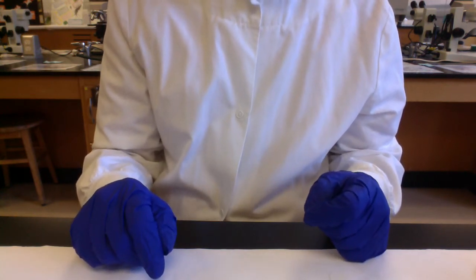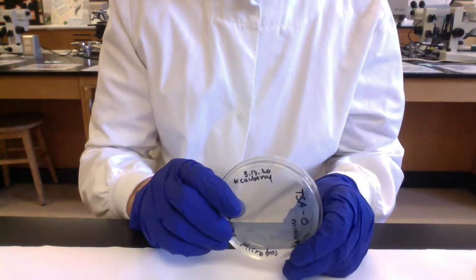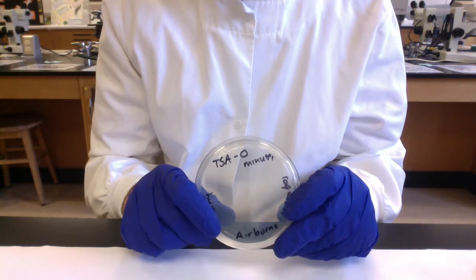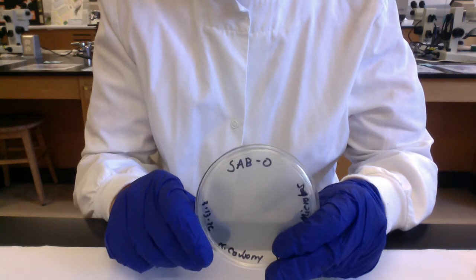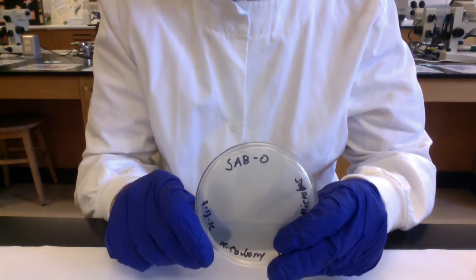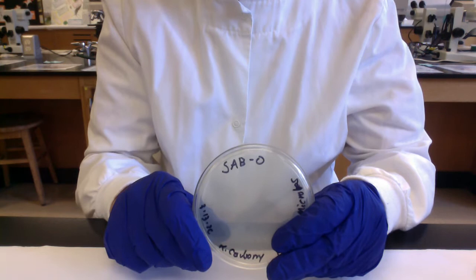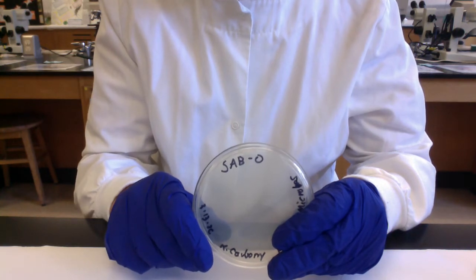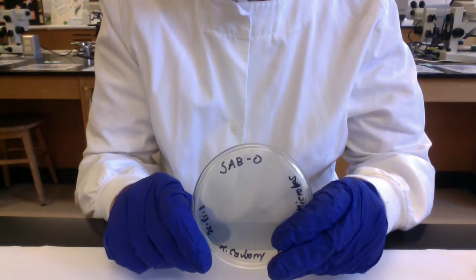So the experiment is set up to compare two different types of media. Tryptic soy agar, which you might remember, is an all-purpose medium, it should support the growth of a wide range of environmental bacteria and fungi. And then the other medium we're going to test is the Sabouraud's dextrose medium. And you'll recall we said this is selective for fungi. It has a high dextrose glucose content, which will inhibit a lot of environmental bacteria. And also it's been acidified. The pH has been lowered, and that too will help inhibit a lot of environmental bacteria. But our environmental fungi should be able to grow on this. So we're going to select for the growth of fungi, so for example, molds and yeasts.